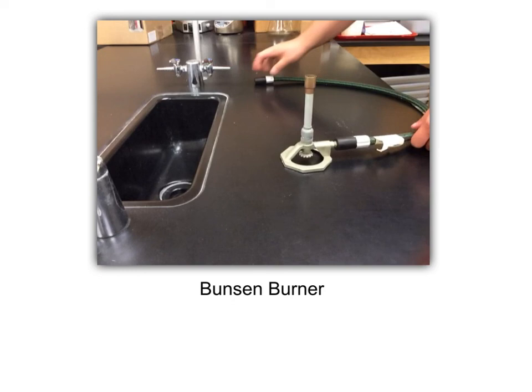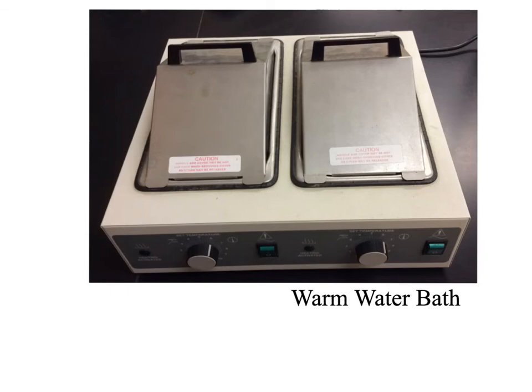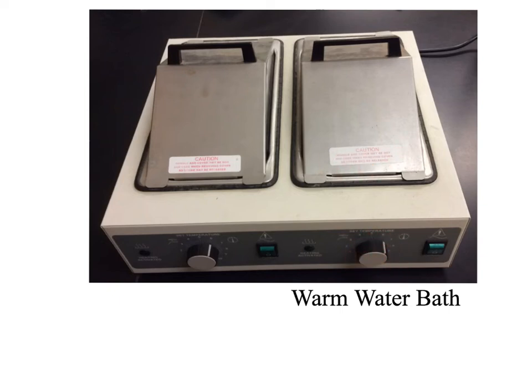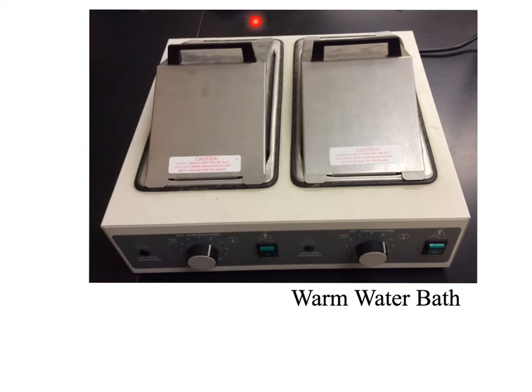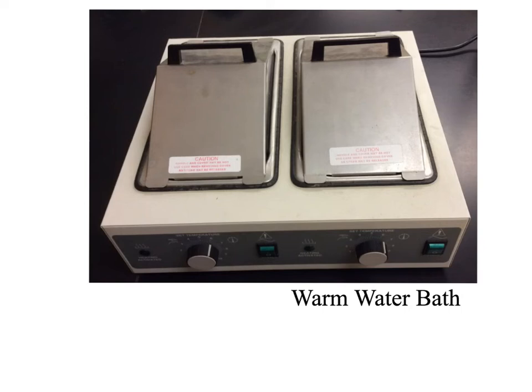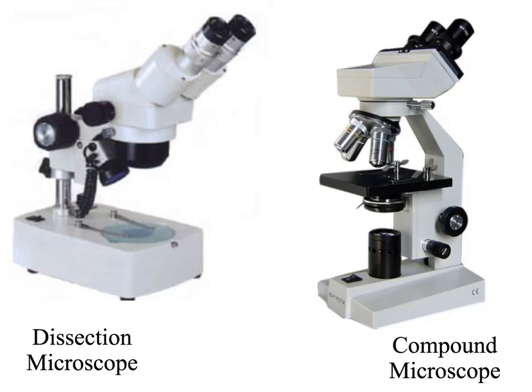This item is called a warm water bath. These lids come off and inside is a tray that you fill with water. You set it to whatever temperature you desire and it keeps things warm at that constant temperature. Its function is to heat water to a constant temperature so we can test the effect of temperature on things — put whatever we want into a test tube and place that test tube into the warm water.